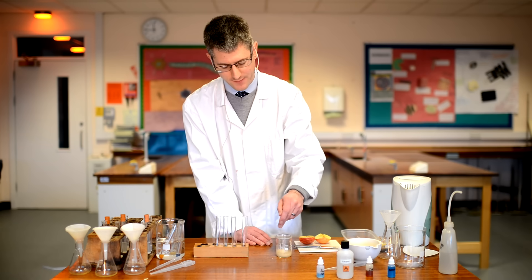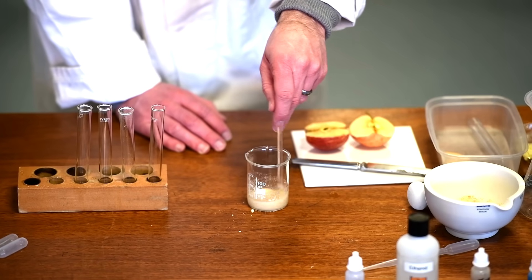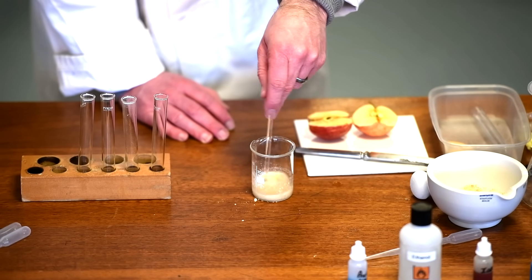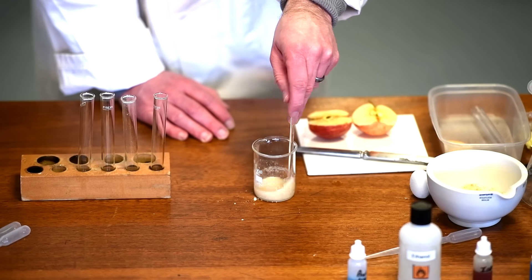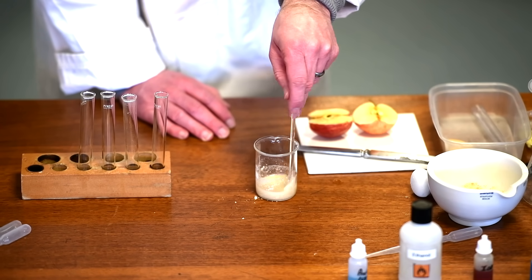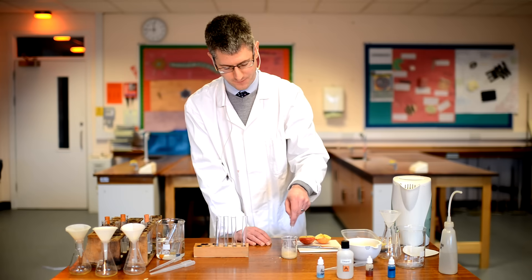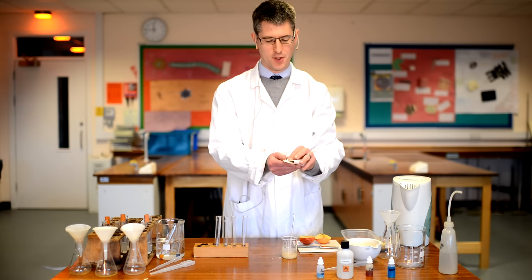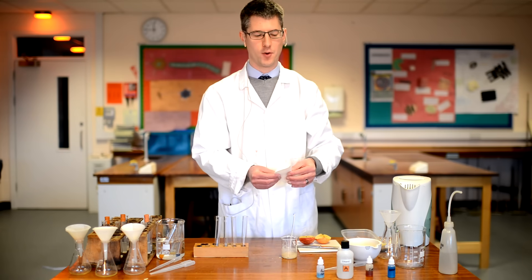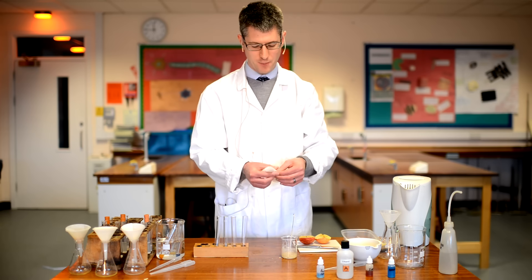What we're trying to do here is dissolve the chemicals in the food into the water — so particularly what we're testing for today are sugars, proteins, and fats. We're trying to get those chemicals out of the food and into the water, so give it a really good stir. While that's dissolving, we have to prepare a conical flask, a filter funnel, and some filter paper — we're going to filter the sample.